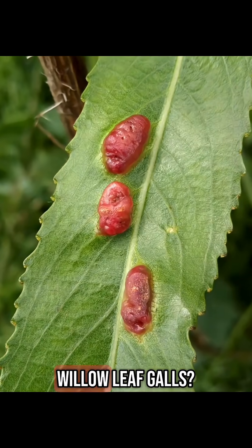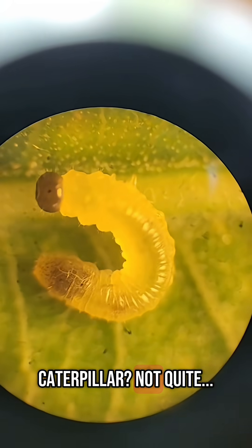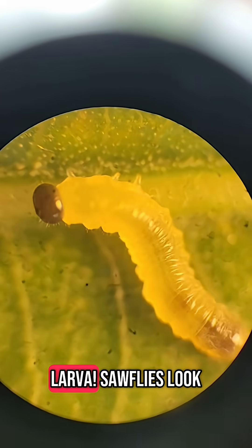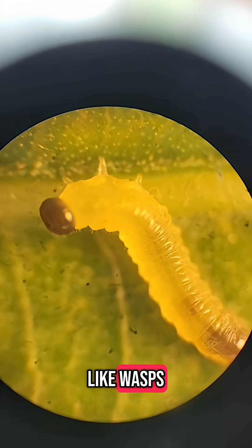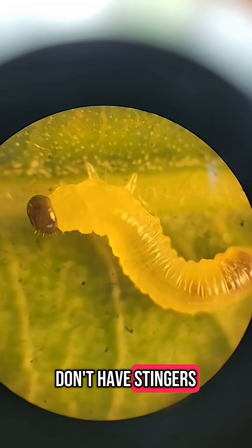How about these willow leaf galls? Is that a caterpillar? Not quite — it's a sawfly larva. Sawflies look like wasps, but they have wider waists and don't have stingers.